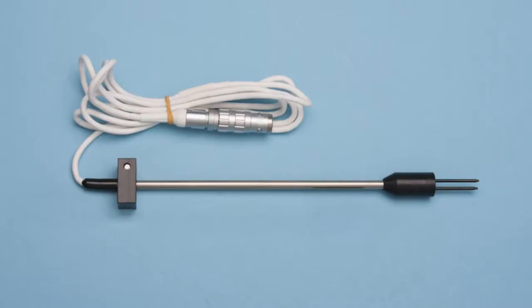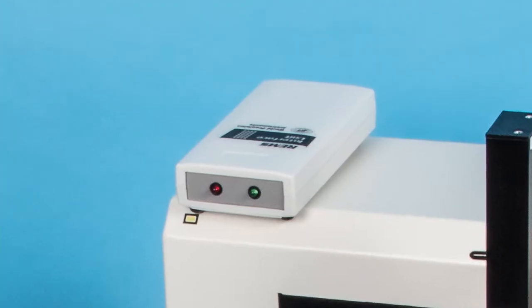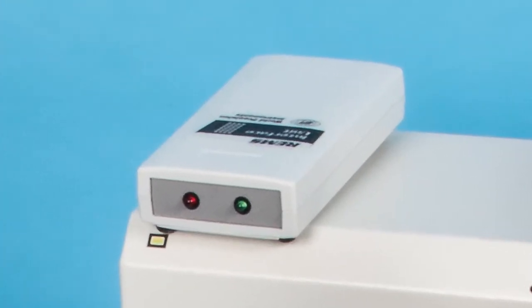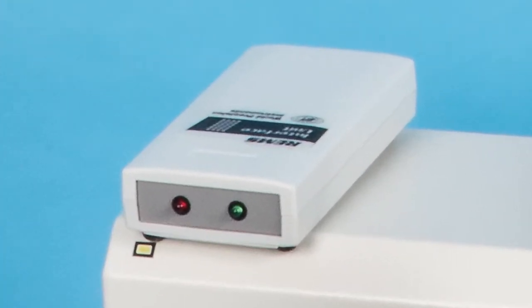The electrode you specified for either a 24 well plate or a 96 well plate, and the interface unit that will join the sensing electrode to the data acquisition board which is already installed in the system's computer.